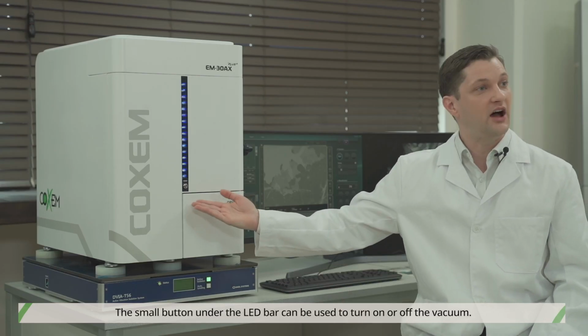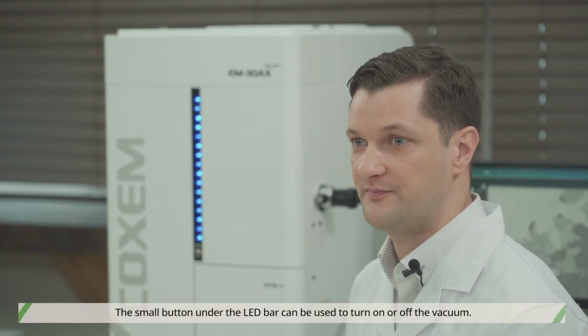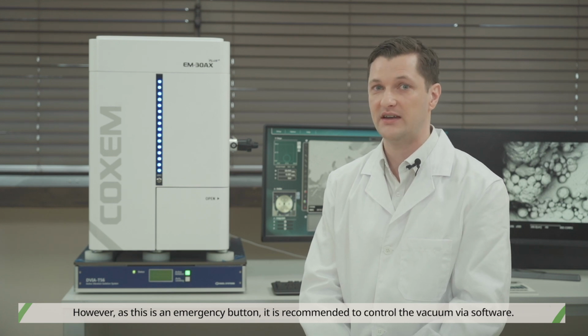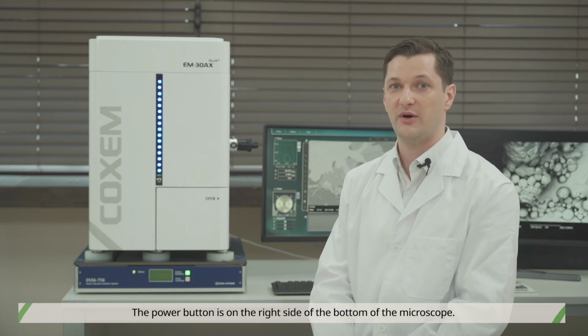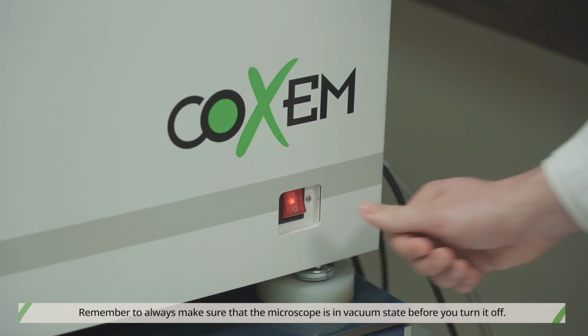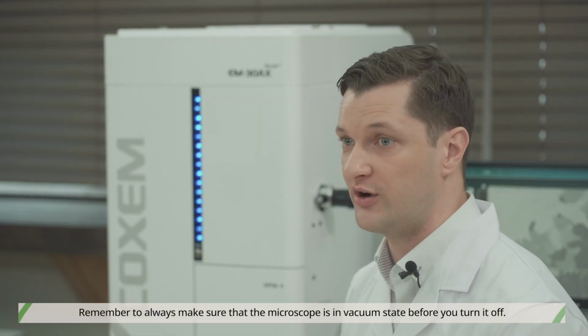The small button under the LED bar can be used to turn on or off the vacuum. However, as this is an emergency button, it is recommended to control the vacuum via software. The power button is on the right side of the bottom of the microscope. Remember to always make sure that the microscope is in vacuum state before you turn it off.